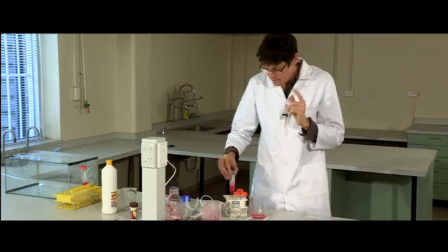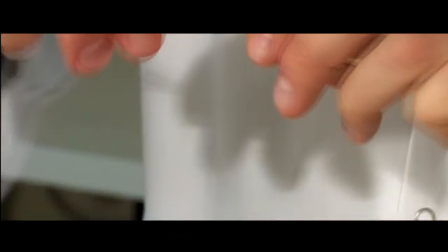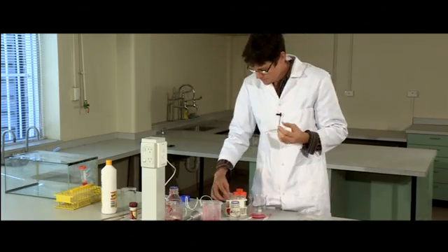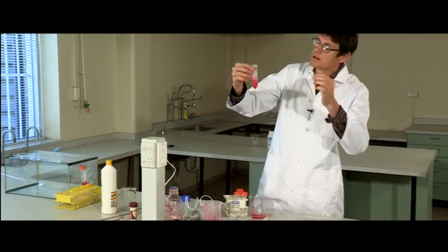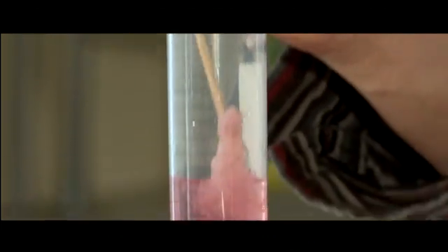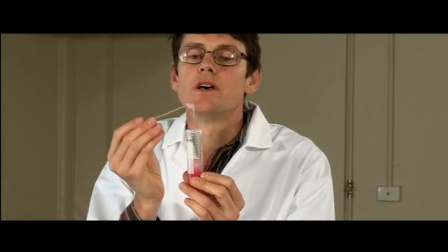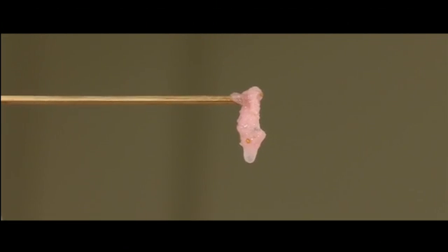The way you can get it out: get some skewers, snap them in half. The best end to use is the furry end that you just broke, so it catches the DNA much better. And then slowly—it's a good sample, look at all that! And now that is cool. That is the secret to life, all the instructions on how to build a strawberry in that cotton wool snotty looking stuff.